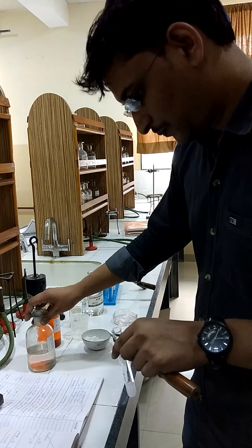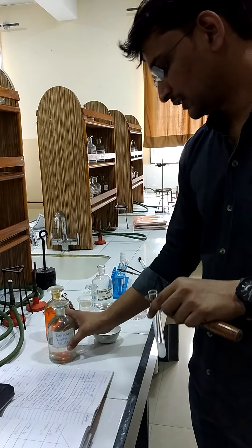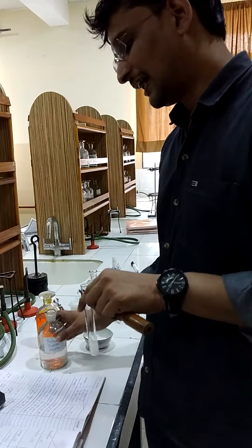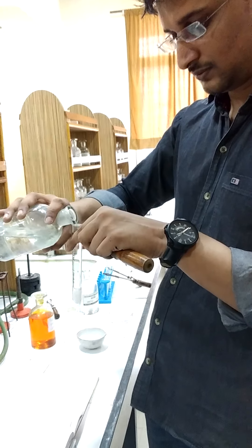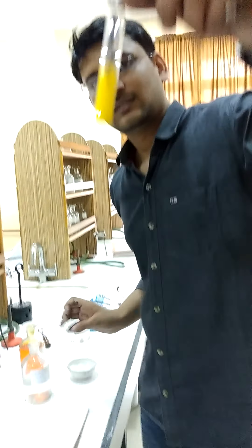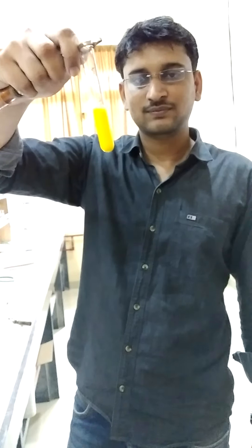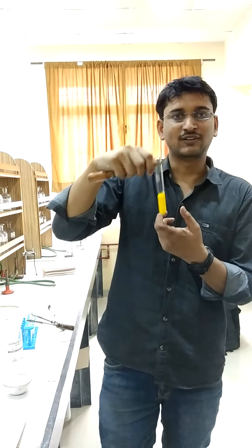Now we are going to use potassium iodide solution. If we get a yellow precipitate, that means lead is present. Here we got a yellow precipitate, so that means lead is confirmed.